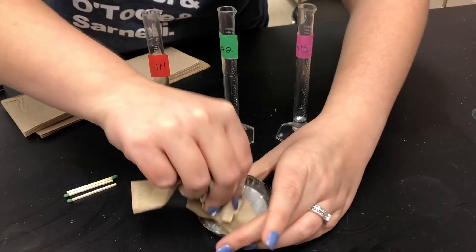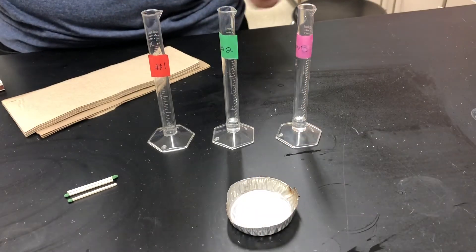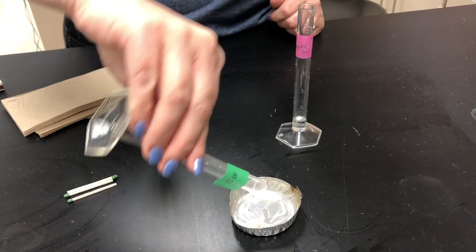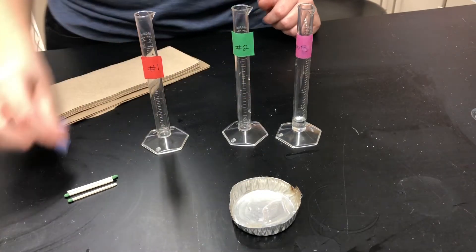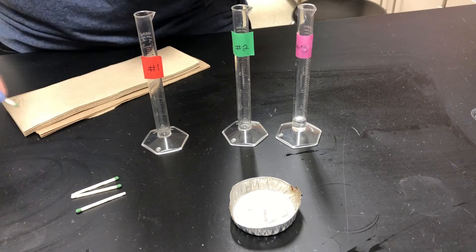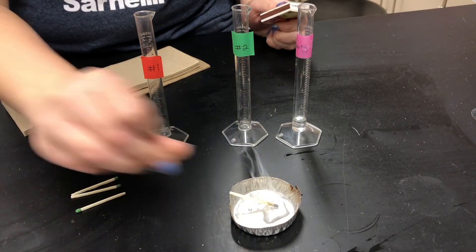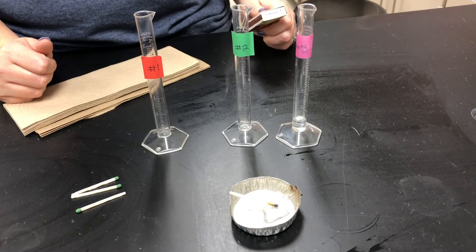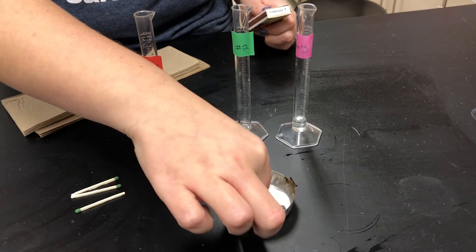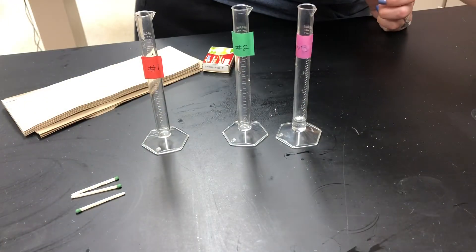We will now wipe the liquid from the cup and we will test liquid number two, placing once again one milliliter of liquid number two in the aluminum cup. We will light our match and place the match in the liquid to observe whether it is flammable or not. As you can see in the video, the match has been extinguished, which indicates that it is not flammable with this liquid.